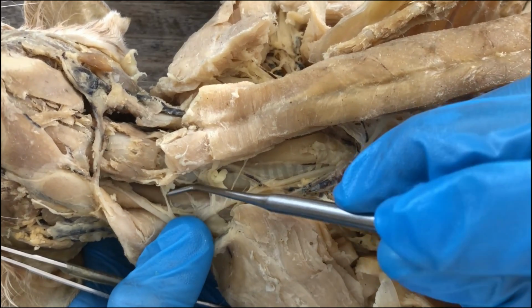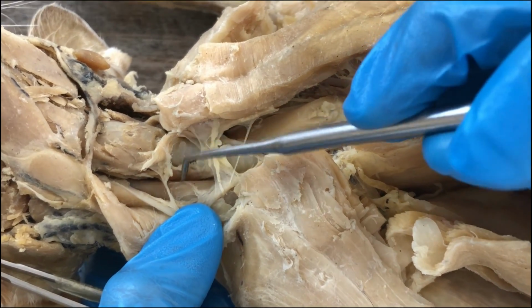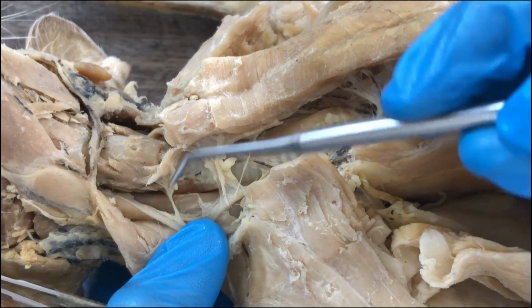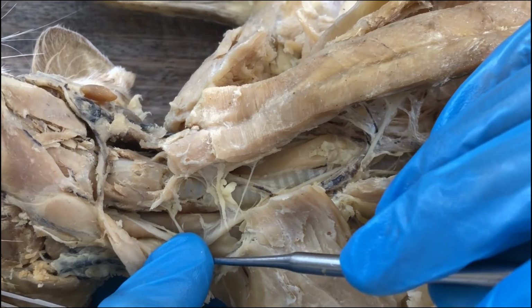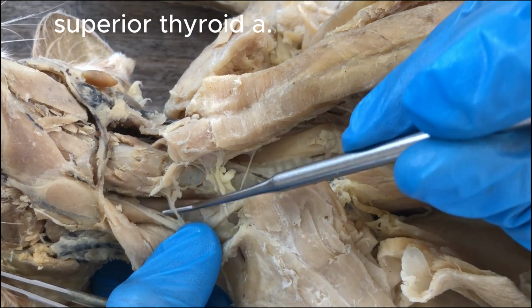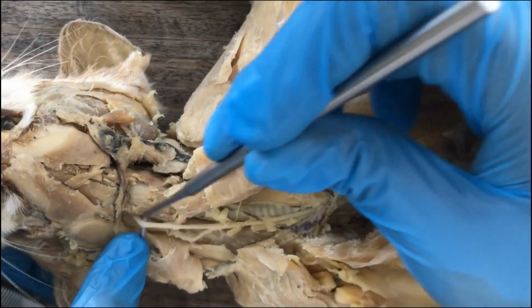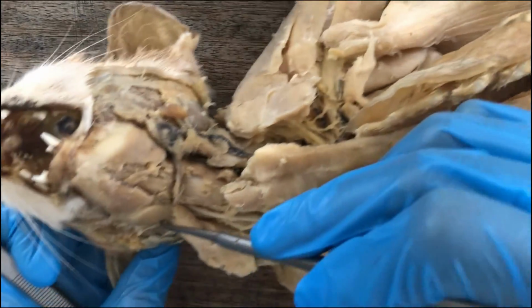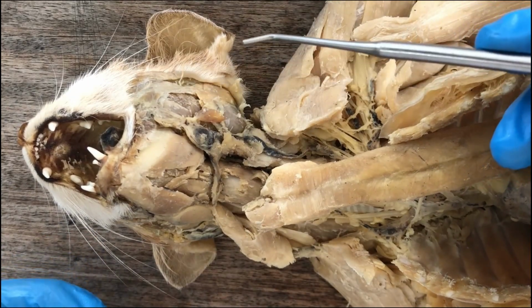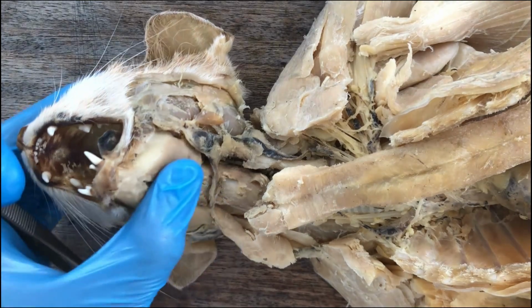But there's one branch going to the thyroid gland. It's this brownish organ here. That's the thyroid gland, and this is the right common carotid. So that branch is the superior thyroid artery. And then eventually the common carotid in the head region will split into the internal and external carotid arteries, supplying various parts of the head.